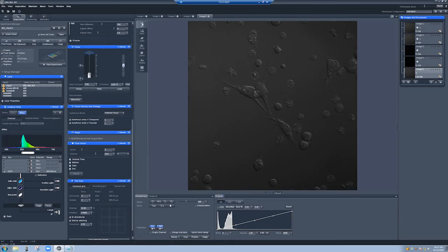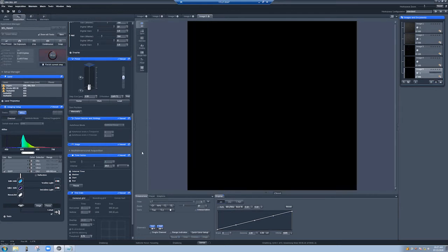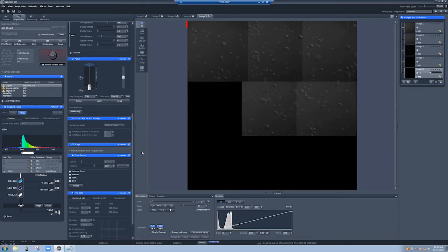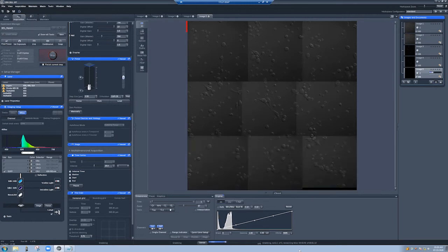So if we did this, it would take 9 images, which would take about 10 seconds-ish, plus the travel time of the system. So maybe we can get away with a 20-second interval, and then it'll repeat that every 20 seconds. So let's see what that looks like. If we start the experiment, here we go. You can see the estimated remaining time here. You can see when it's waiting, it'll tell you how long remains in the wait time here.